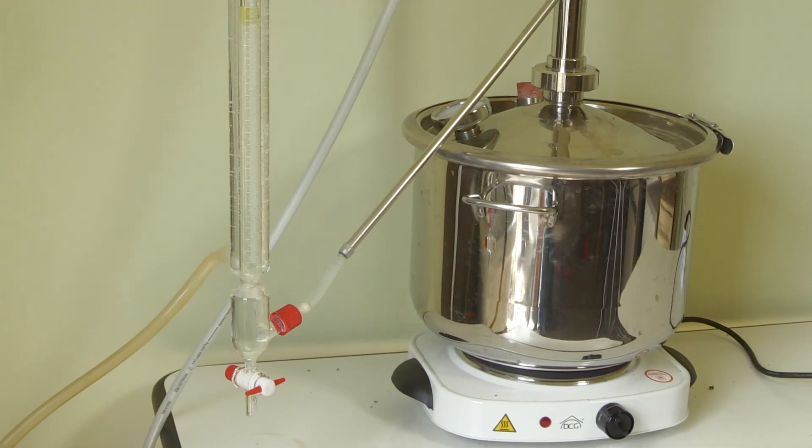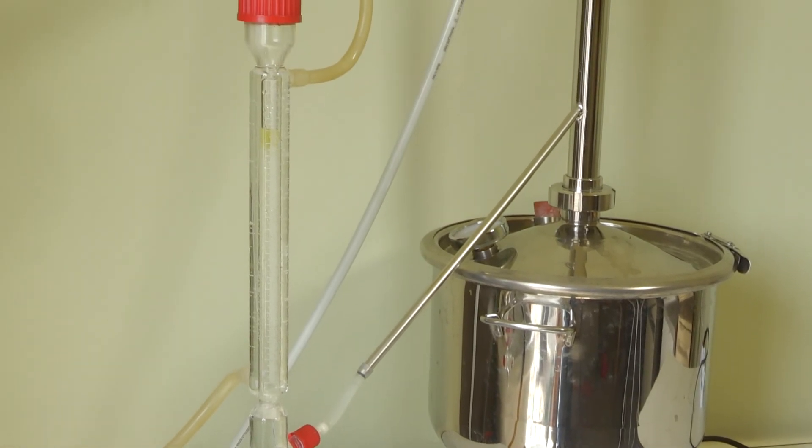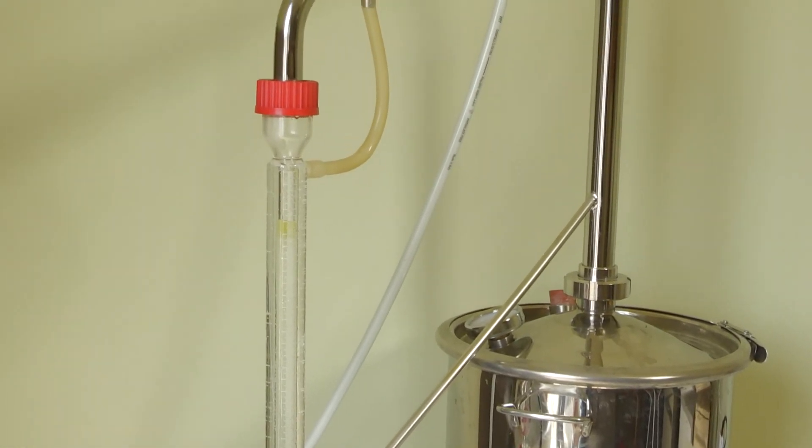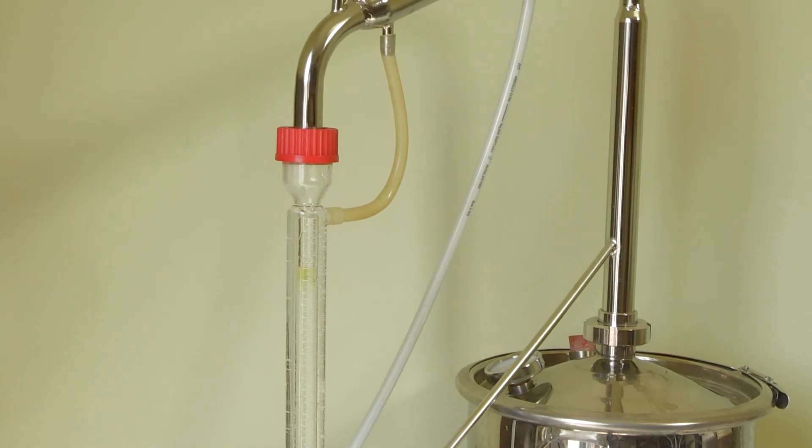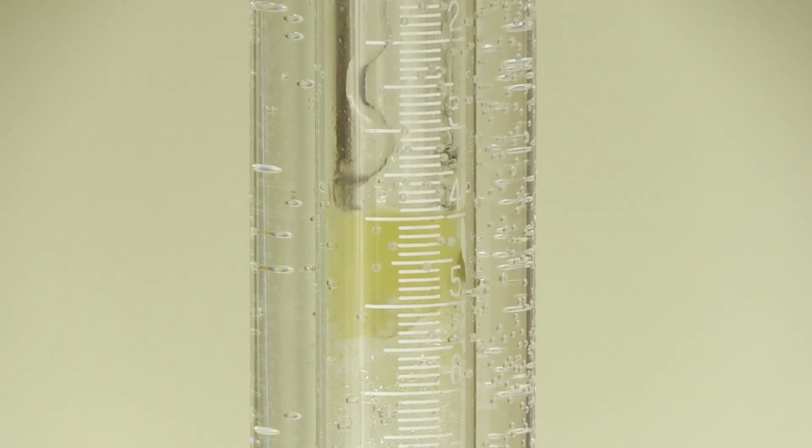The rosemary essential oil and the underlying hydrolate obtained as byproduct of the extraction can be collected and used for different purposes.